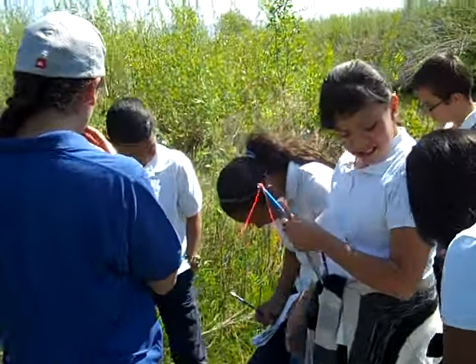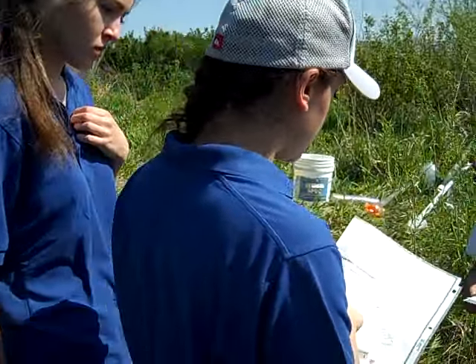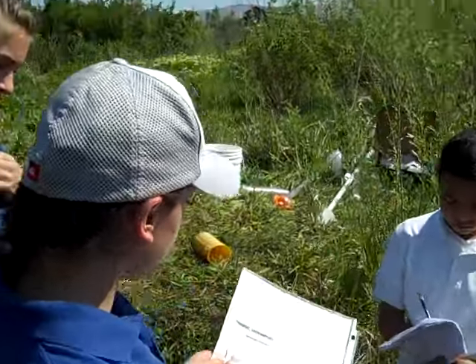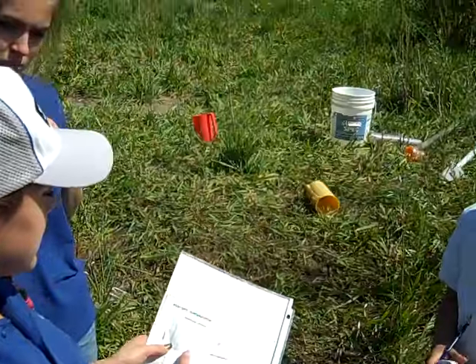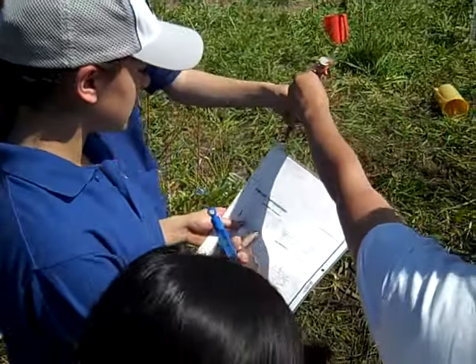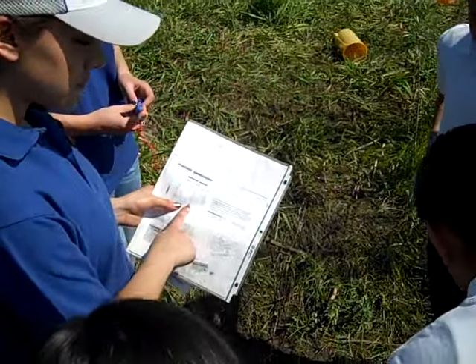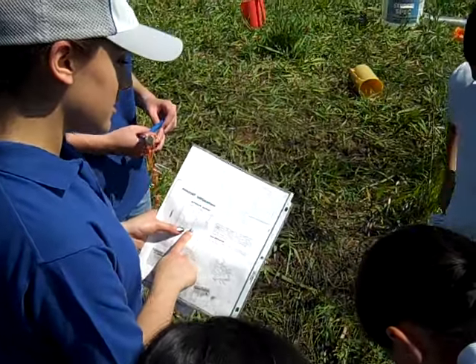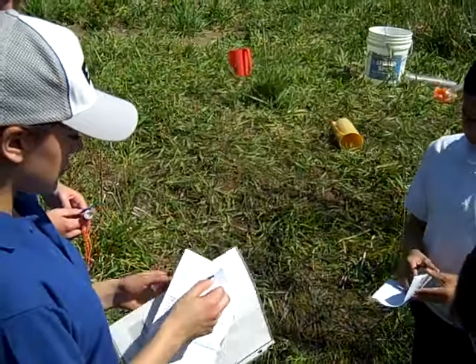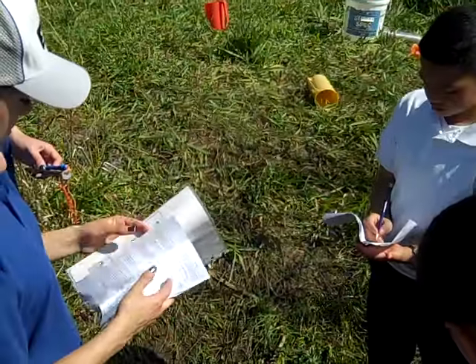Okay. Since we have 4 ppm for dissolved oxygen and we got 14 for temperature, we're going to have 39 percent. That's the percent of the dissolved oxygen. That's how saturated. I don't know if you guys have heard the word saturated. That's how much of the percentage of water is saturated with oxygen. So that's how much oxygen there is. You can write that in there. Yeah, it goes right there. That's all we need.